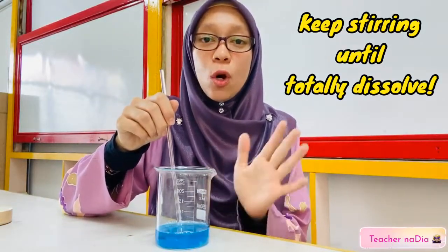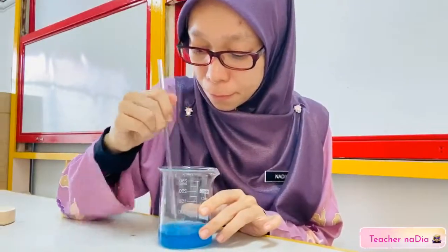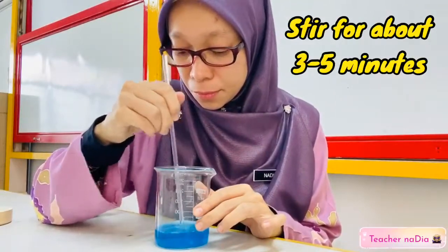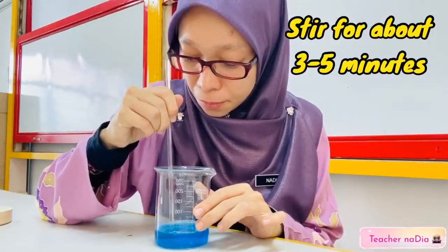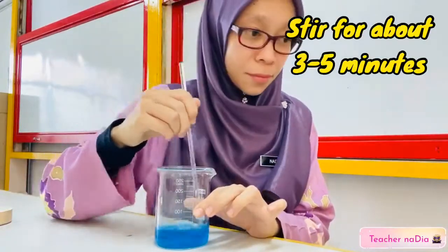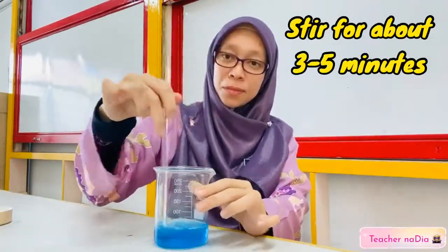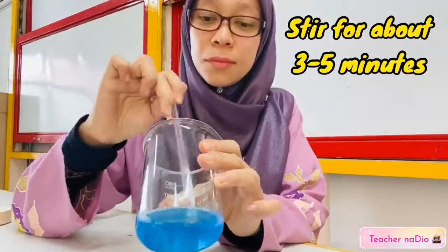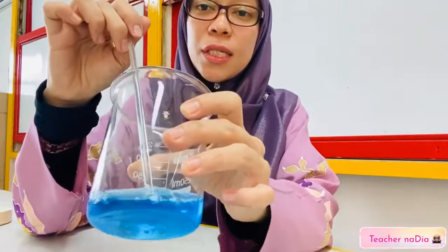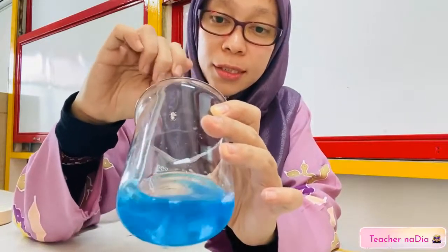We must make sure that all the copper sulfate will dissolve in the water. If you can see, all the copper sulfate has dissolved in the distilled water.